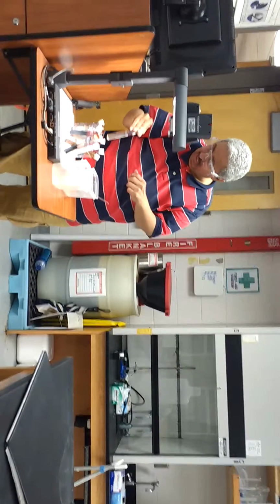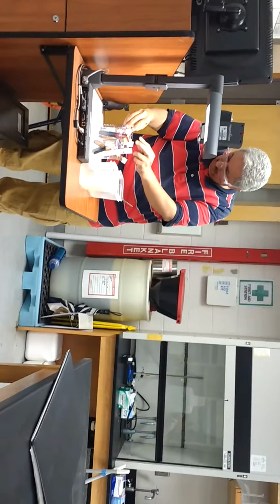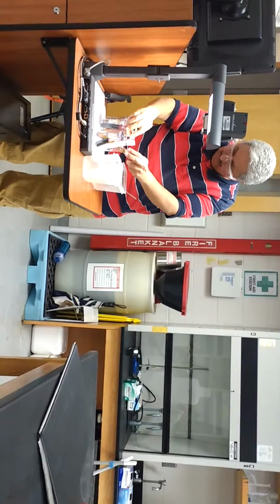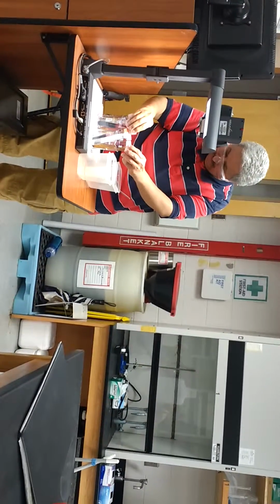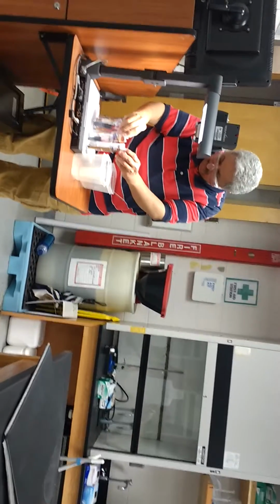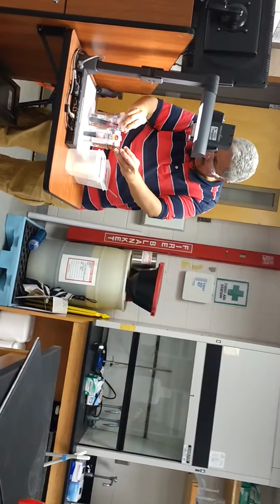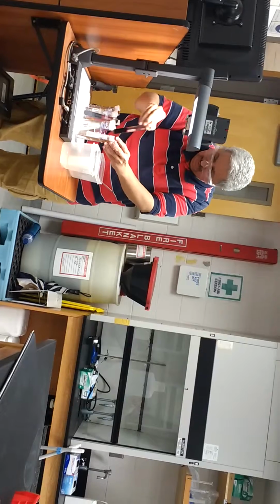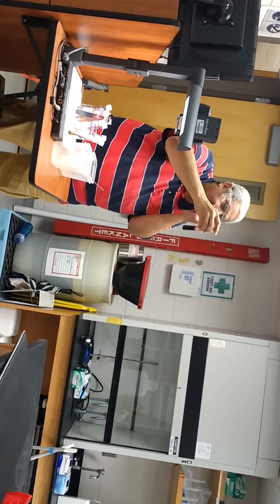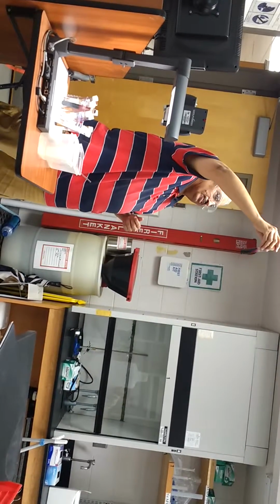And the second one, let's look at the iodine. Maybe you'll find the iodine here somewhere. Well, I don't see the iodine here, but believe it or not, iodine is really soluble in cyclohexane. That's the iodine. Here it is. Sorry, I gave you a permanganate. That's the iodine. When you dissolve iodine in cyclohexane, you get this.